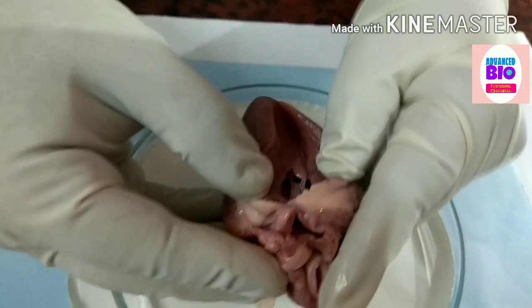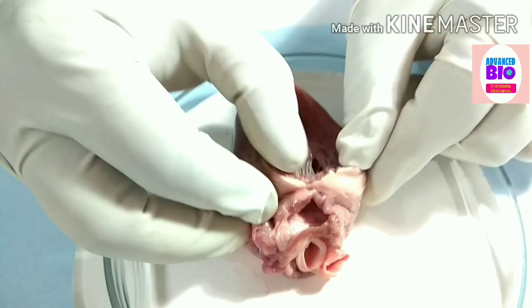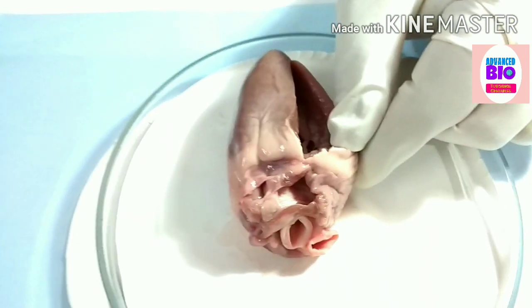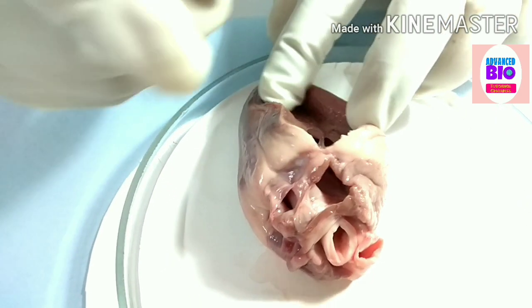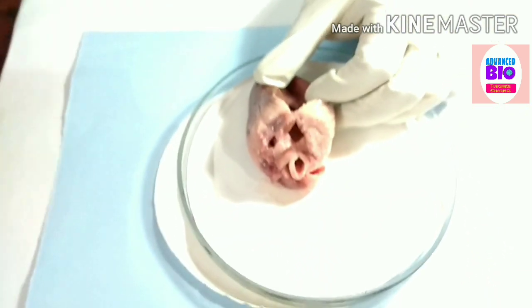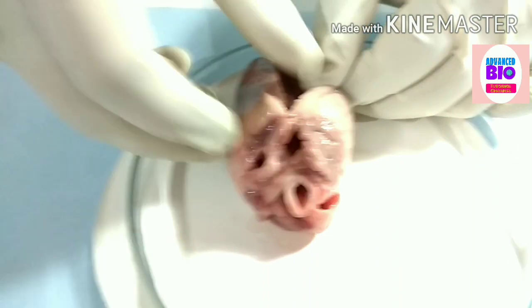See here — I'm giving more light. See this — this is the left ventricle. Here is the chamber and you can find the papillary muscle here. I have to give one more incision to show you another papillary muscle.